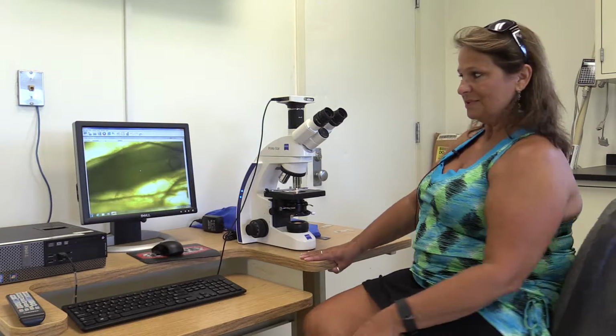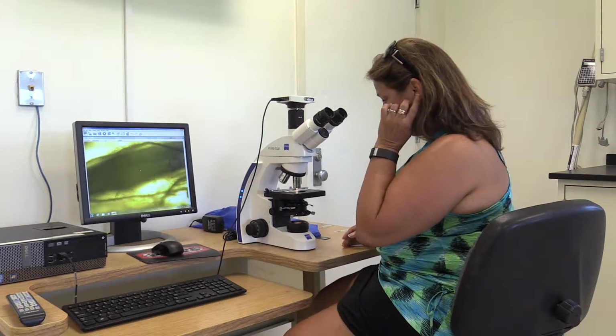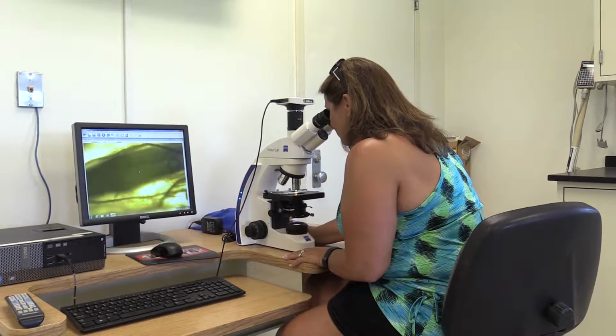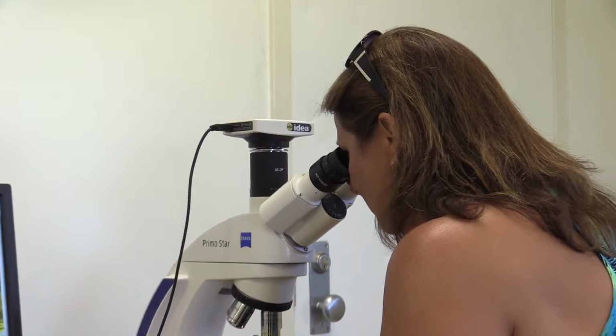So we collect samples and then thankfully we have this nice microscope here, make wet mount slides, and we actually have some plant tissue here. And so I studied the roots and studied the whole plant, and what I found was the culprit that I thought might be there is indeed there.